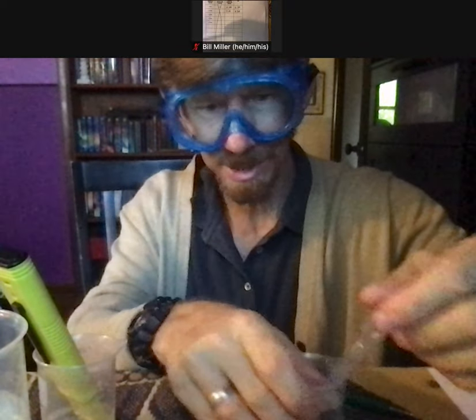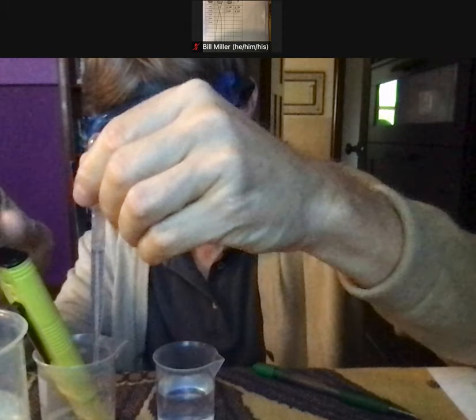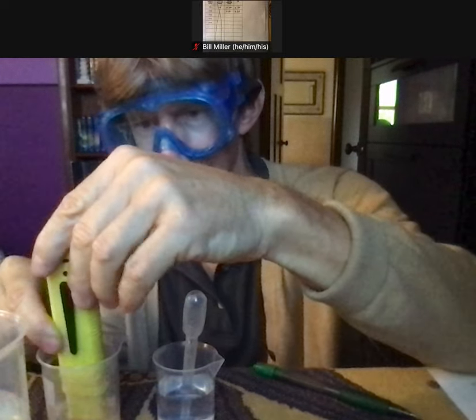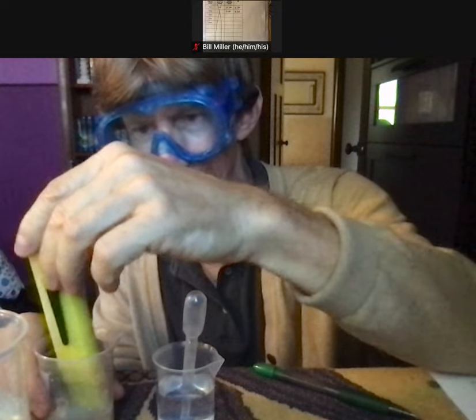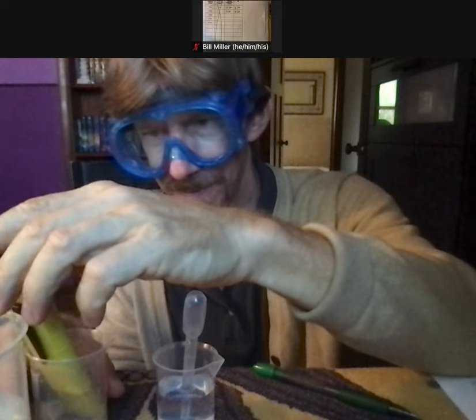I said to do it three more times. You can see the pH probe is leaning up against the other beaker. Two milliliters more. My pH meter went off, but that doesn't matter. You're adding a base, so your pH should go up — it's not going to go up very much this time. I got 3.55, so I added 2.00 more, my total is now 4.00, and I have 3.55 for a pH.